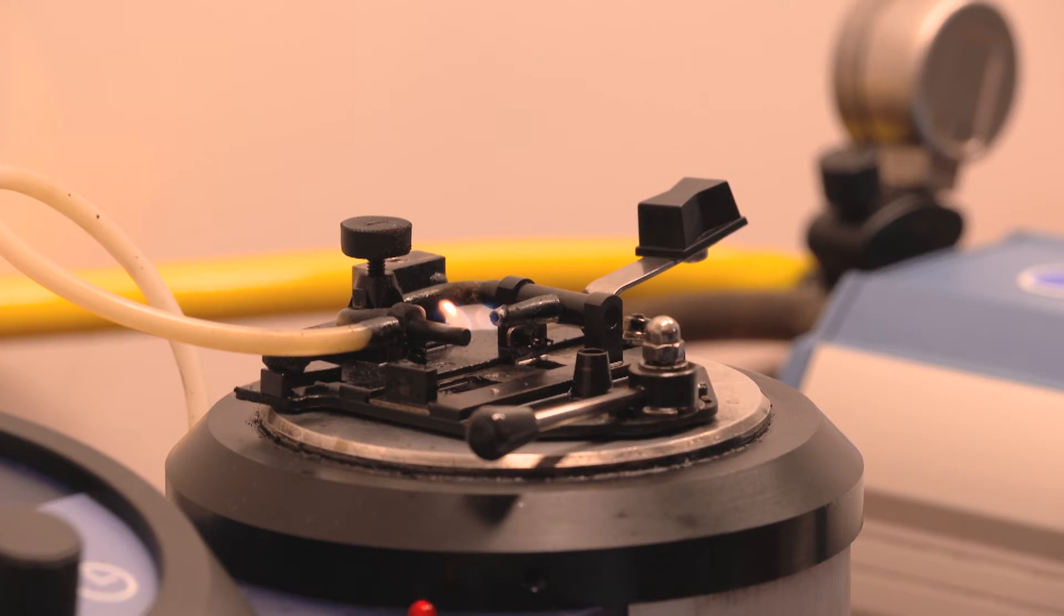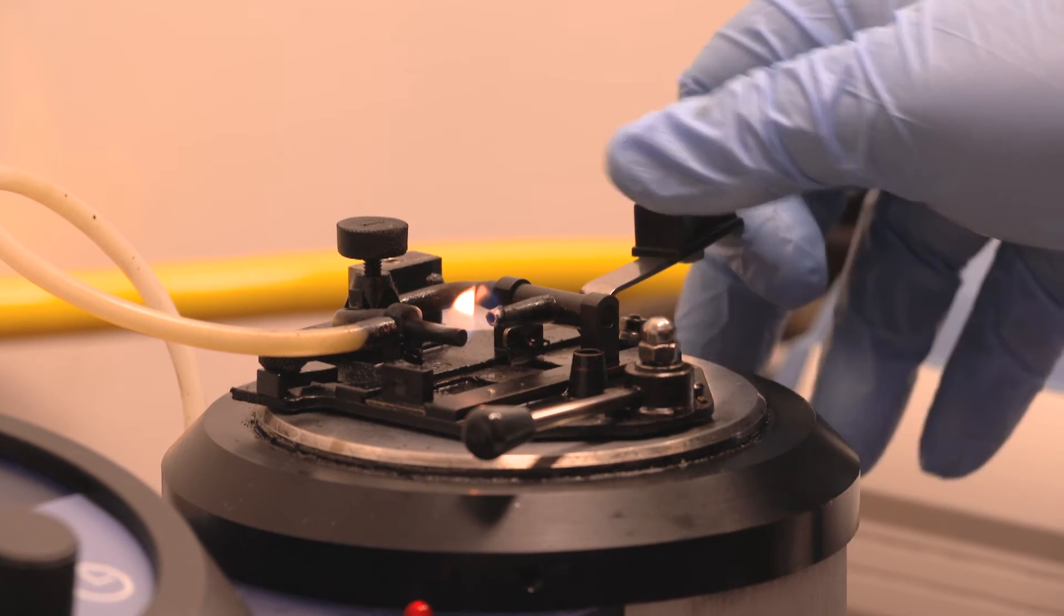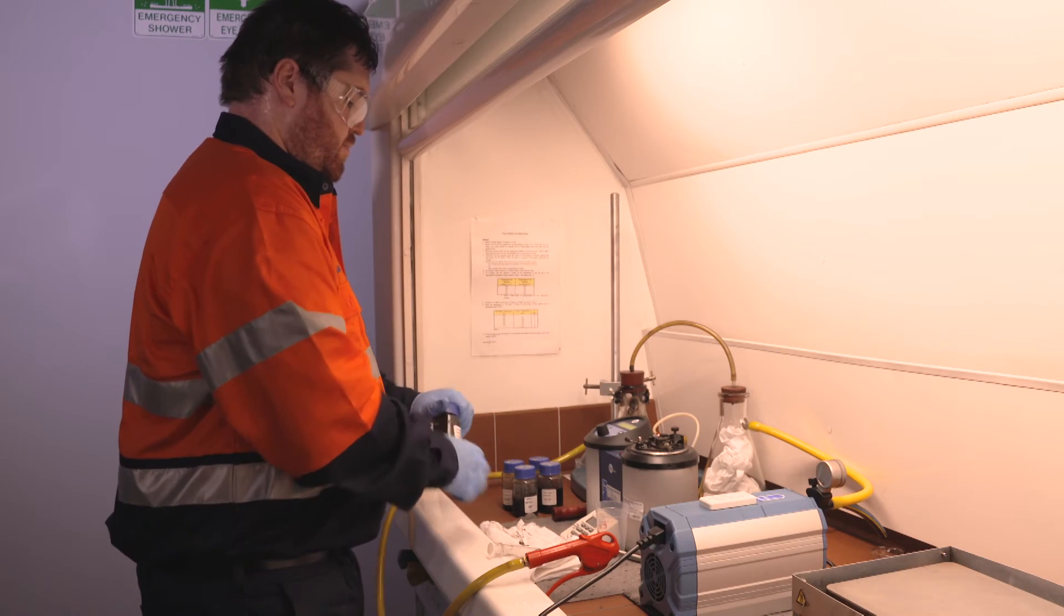If fuel is present, a flash will be observed. The temperature at which the flash occurs is related to the amount of fuel in the engine oil sample.